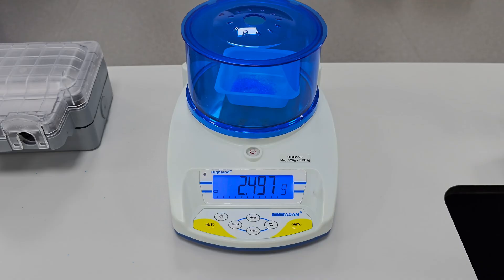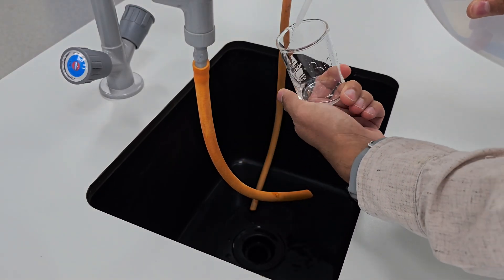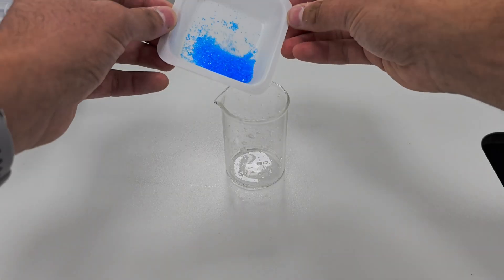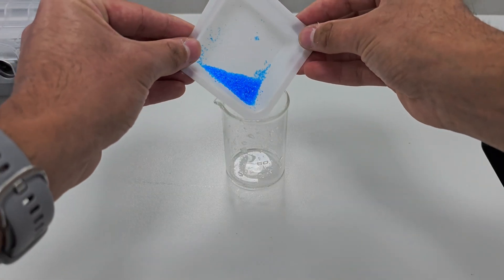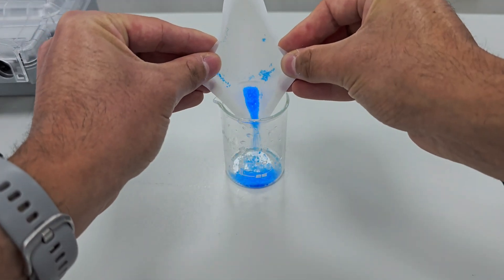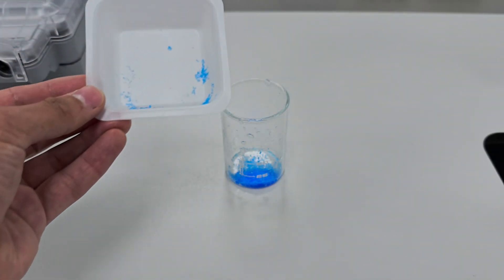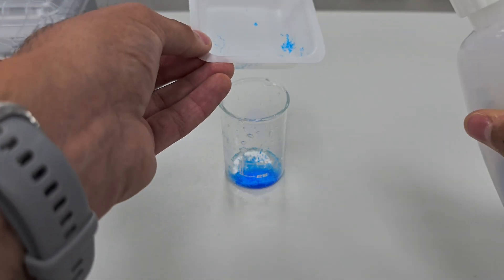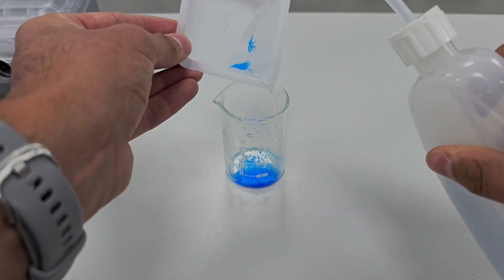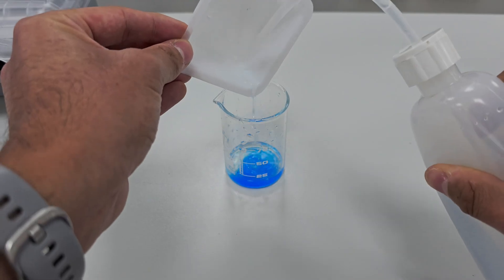Now that we've measured the copper sulfate, I'm washing a clean beaker with distilled water to ensure there's no contamination. Then I transfer the copper sulfate into the beaker. To make sure no crystals are left behind, I squirt some distilled water from a wash bottle into the weighing boat to transfer all of the solid into the beaker.